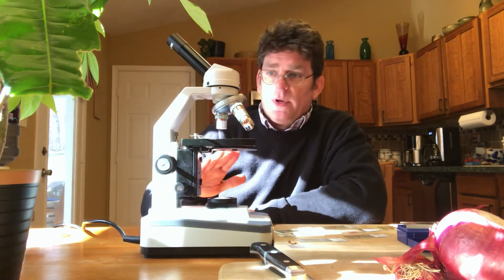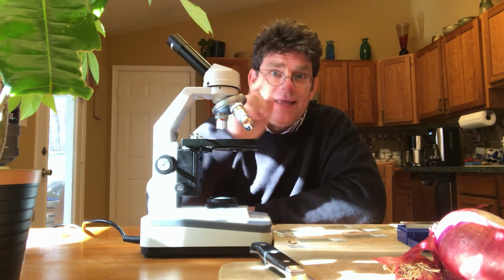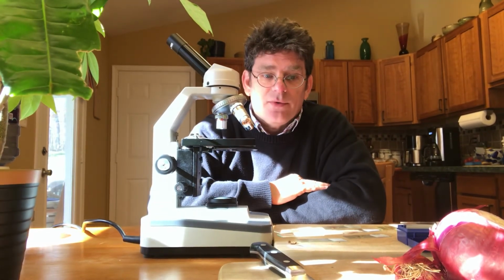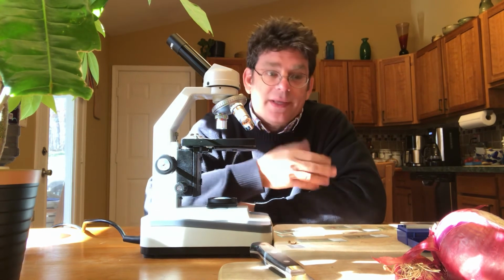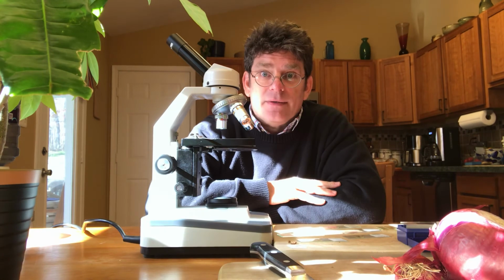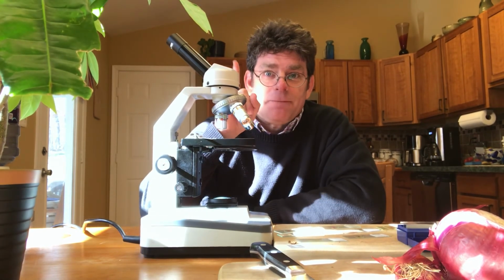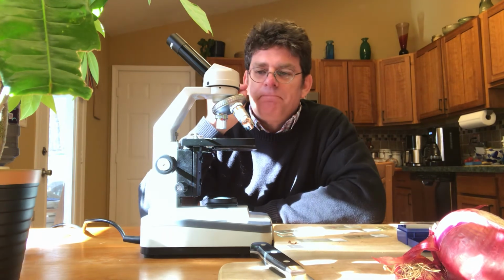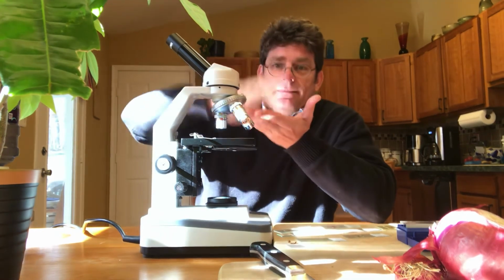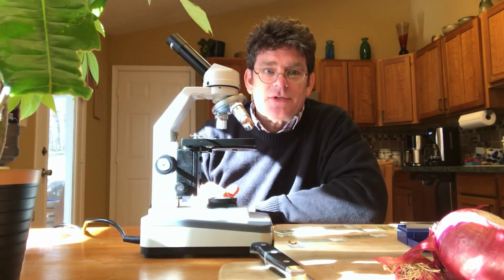But I just want to give you a real quick look at a compound light microscope. And again, what I'm going to try to do as best I can is use my phone to put on the lens and see if I can photograph some of this, just to show you kind of what some of these cells look like before we really get into the organelles and the parts and that kind of stuff. So from this, Robert Hooke looked at cork cells, came up with the name cells. I'll show you what they look like in just a few minutes. How to make a wet mount slide: thin piece, slide, specimen, cover slip, and a real quick look at the compound light microscope.